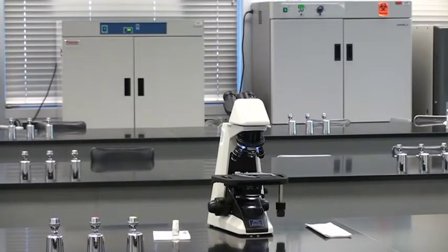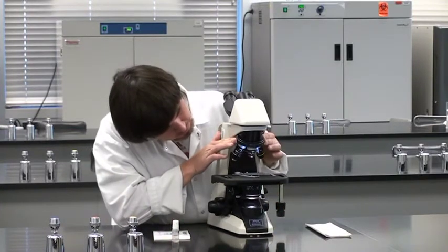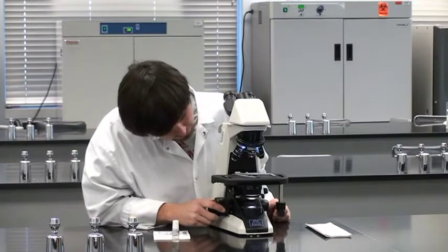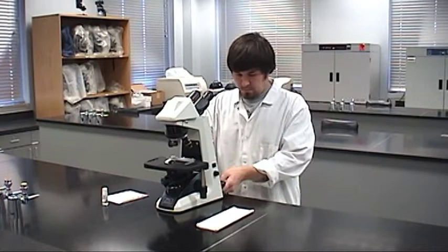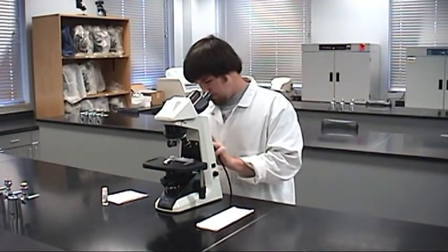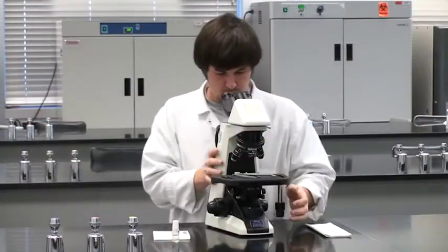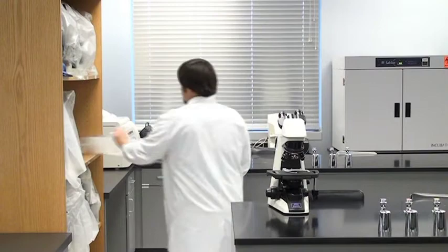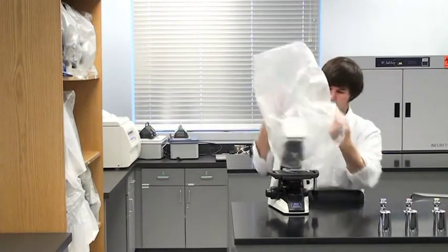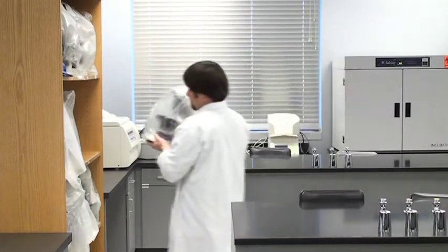When you are finished with the microscope, store it properly. Verify that the scanning objective is in position and move the stage to its lowest position. Turn off the light switch and unplug both ends of the power cord, then wrap it onto the cord hangers. Carry the microscope back to the storage area using two hands as before. Cover it with a dust cover to protect the optics, then place it in its storage location.